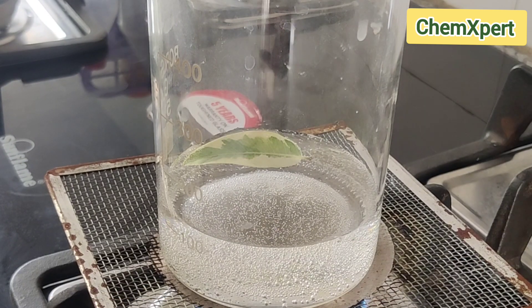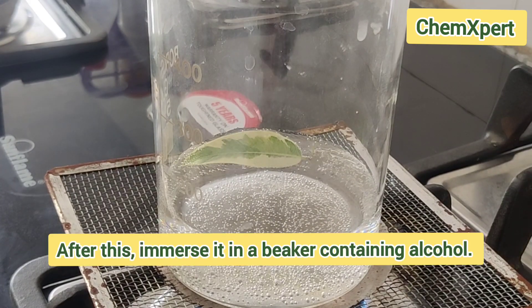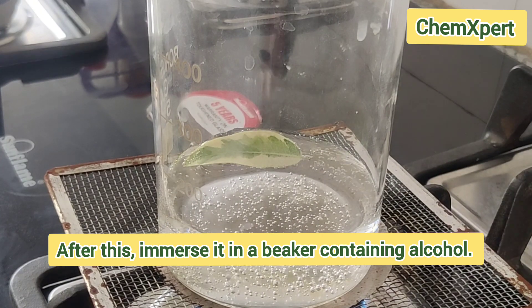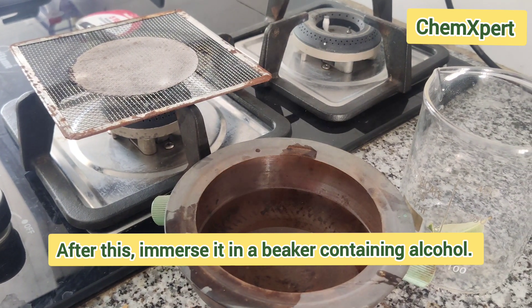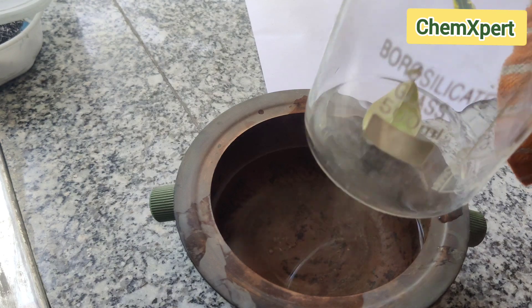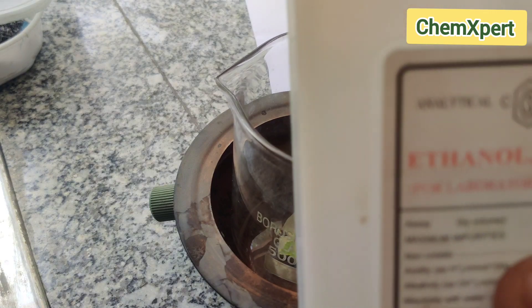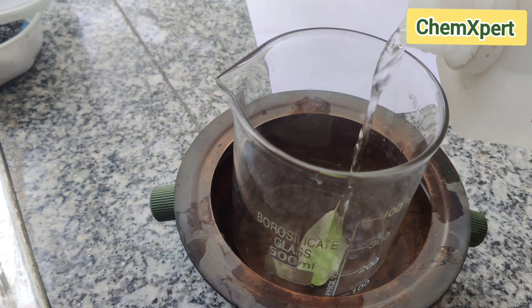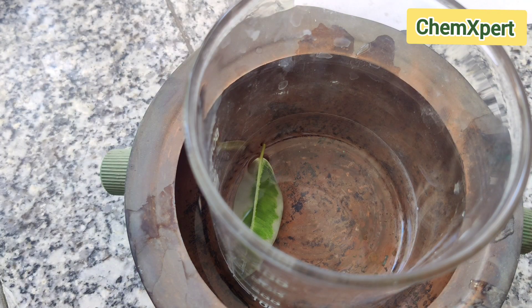After heating for a few minutes, we place this leaf in a beaker containing alcohol and heat it. We can't heat alcohol directly over a flame because it will catch fire. So we place the beaker in a hot water bath and add ethanol into it. This way, the temperature of the alcohol increases without direct flame.